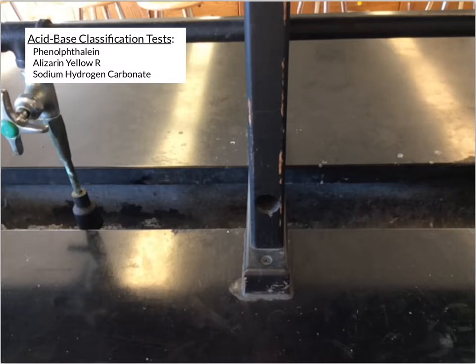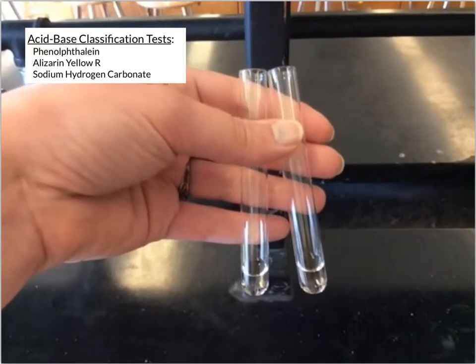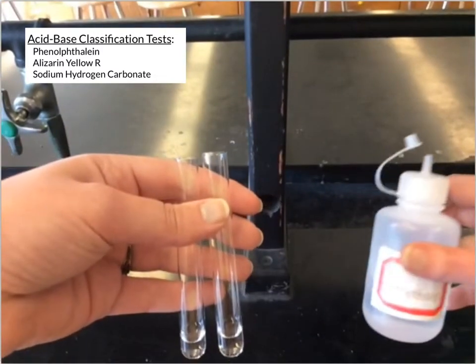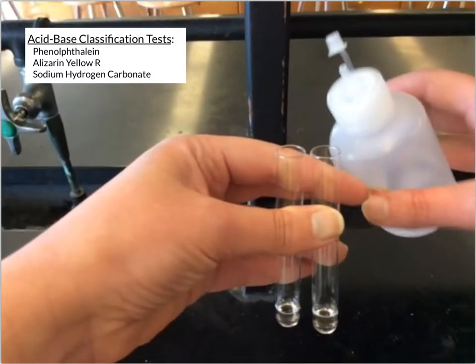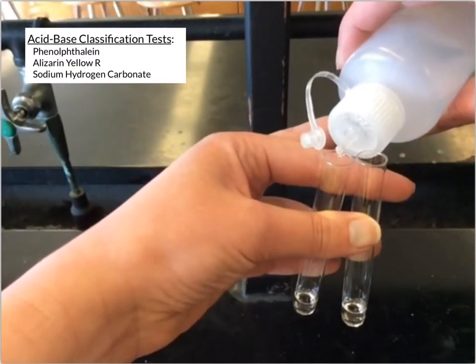Now we're going to look at 3 more tests we can use to help us understand a little bit about the acid-base characteristics of a substance. We'll use 3 different liquids and see the different types of reactions that you would observe from these. So I've got 2 test tubes here with 2 different solutions. They have different acid-base characteristics. And then I have some phenolphthalein. And so this is a common indicator we would use in acid-base chemistry. And so I'm going to add a few drops of this phenolphthalein to each test tube, and we'll see what changes.